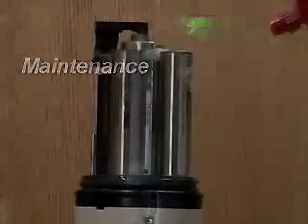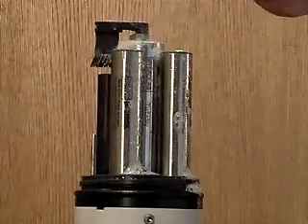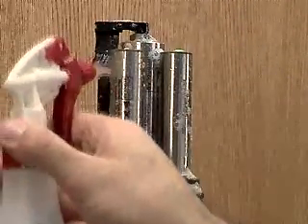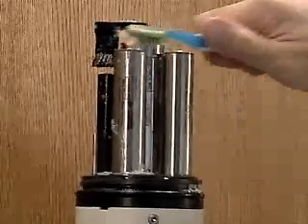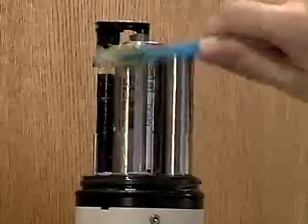Maintenance. The only maintenance required for the fluorometers is to keep them clean. As optical sensors, it is very important to give them a clear field of view into the water sample.